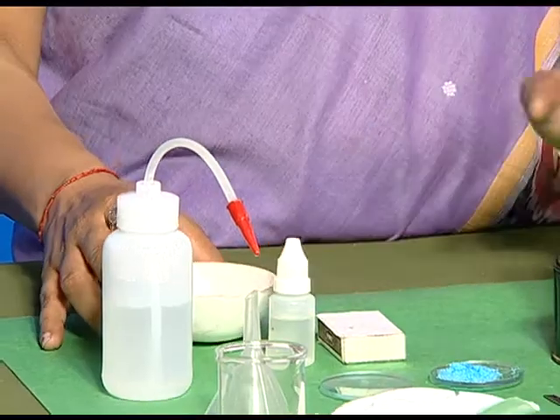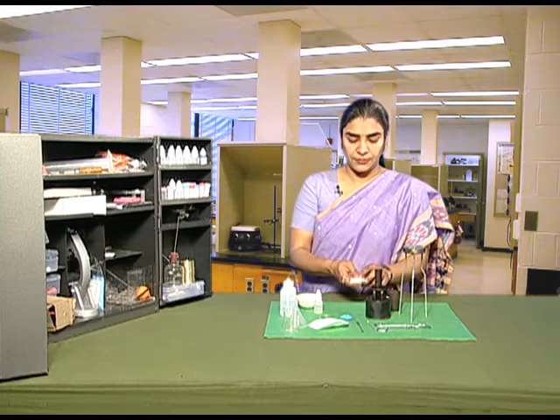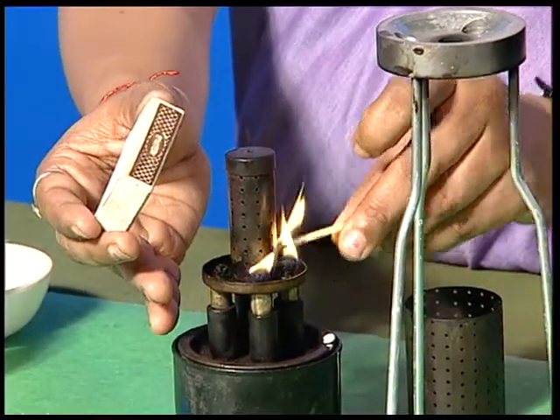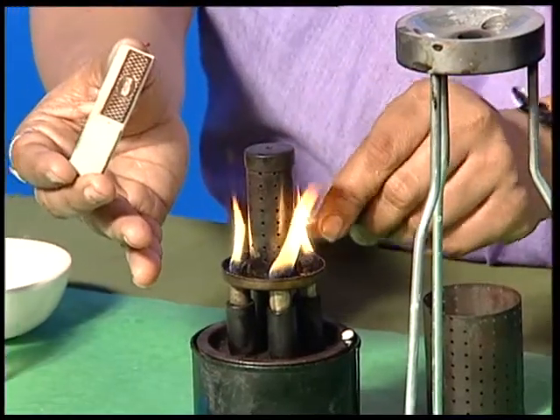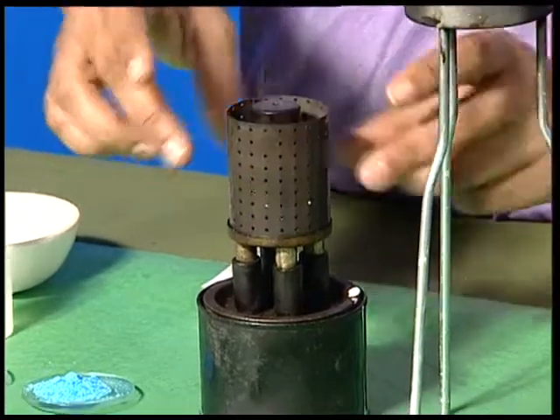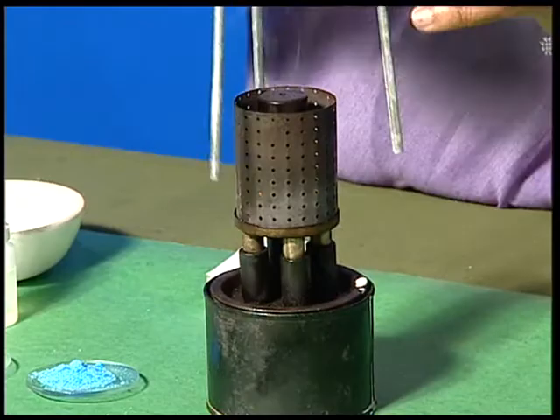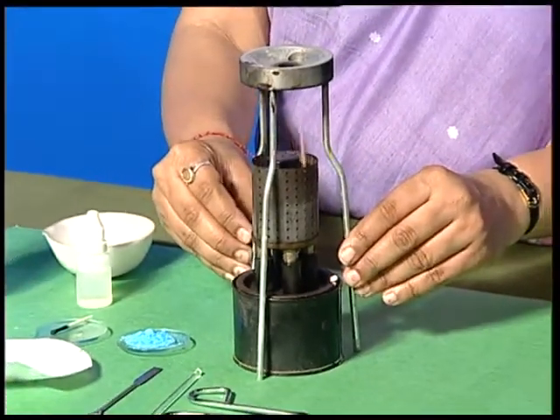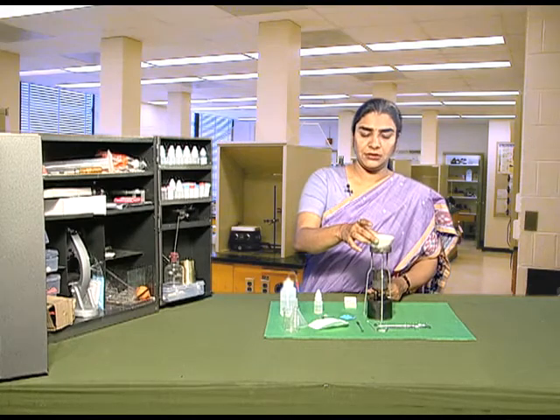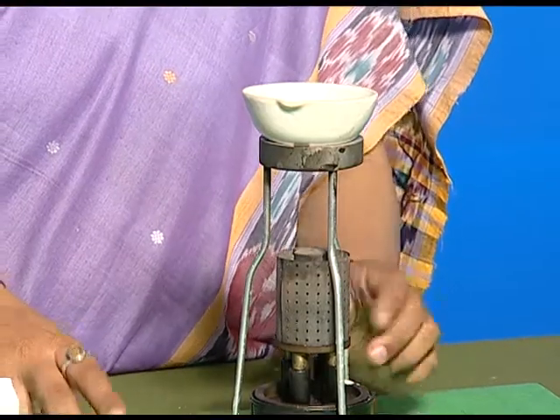Now light the kerosene burner. Be careful while lighting the burner. Quickly cover it with the stand and place the tripod stand on it. Now place the china dish and let the water get heated for some time.